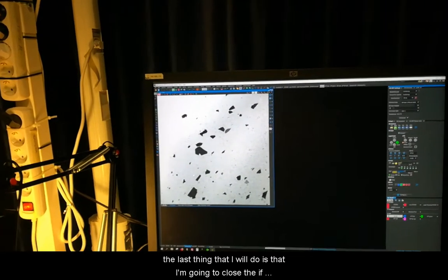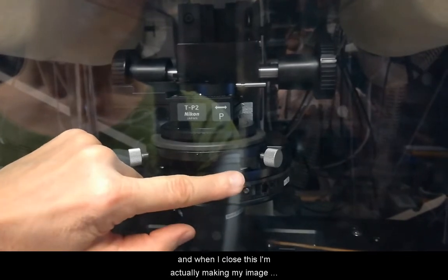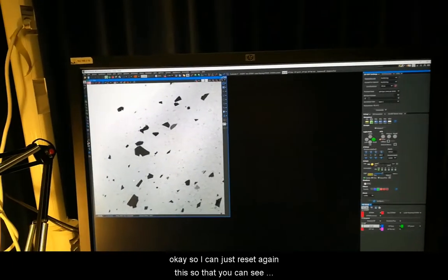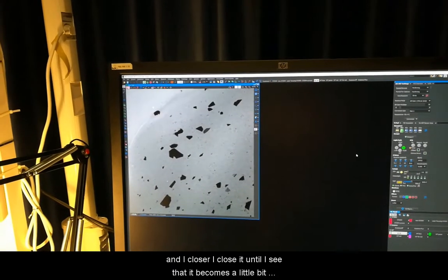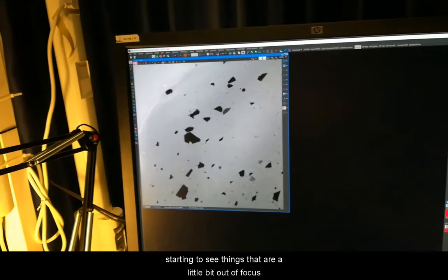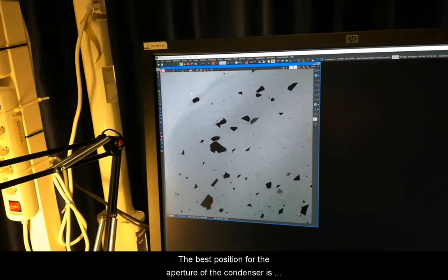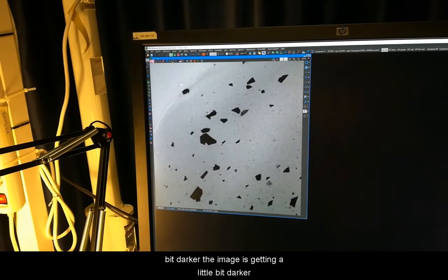The last thing I will do is close the condenser aperture. If you look at the condenser here, there's a little slider on the side edge. When I close this, I'm making my image more contrasted. I close it until I see it become a little bit darker. When closing the aperture of the condenser, I'm making things more contrasted, but I also start to see things a little bit out of focus — that's dirt on the other side of the coverslip, and I don't want to see that. The best position for the condenser aperture is the same as the numerical aperture of the objective. Otherwise, close just until the image gets a little bit darker.